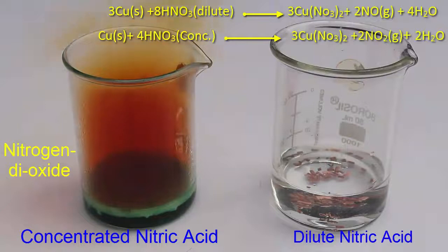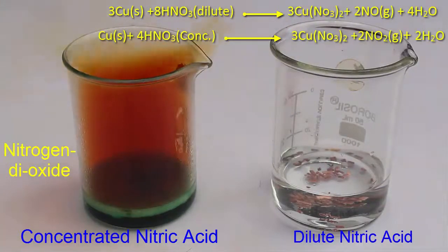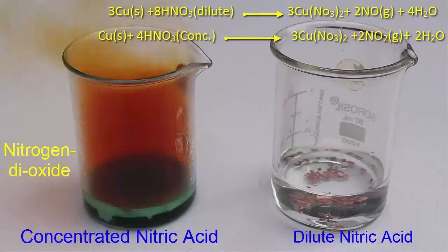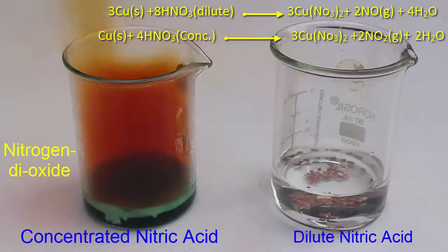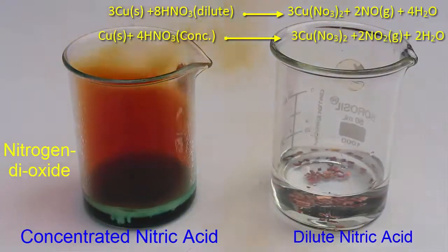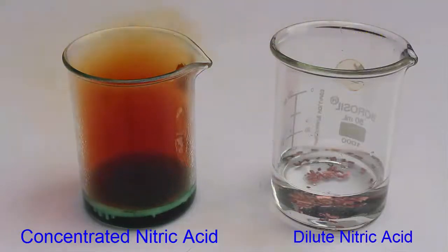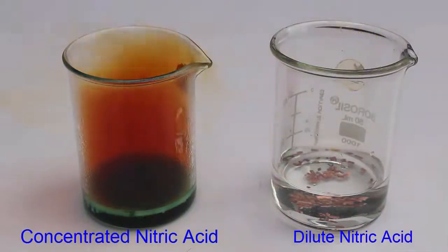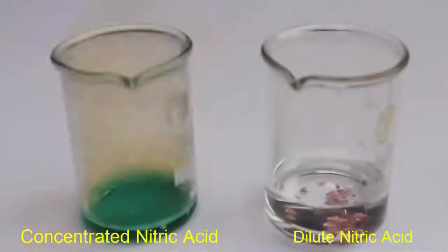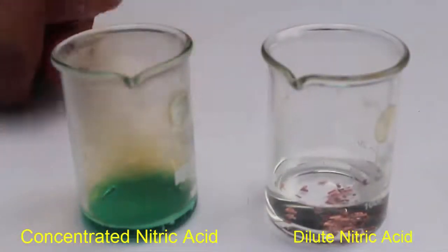You can see a green liquid in the base of the beaker. In the second beaker containing dilute nitric acid there is no reaction in the copper flakes. We can also say that the reaction rate in the first beaker is very fast, whereas in the second beaker the rate of reaction is slow.